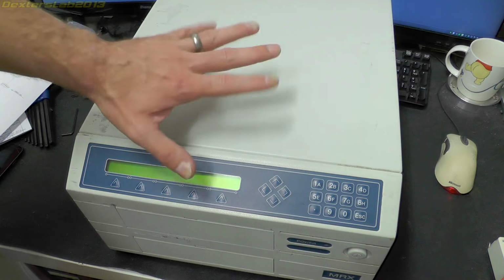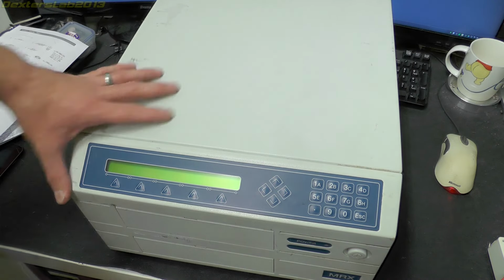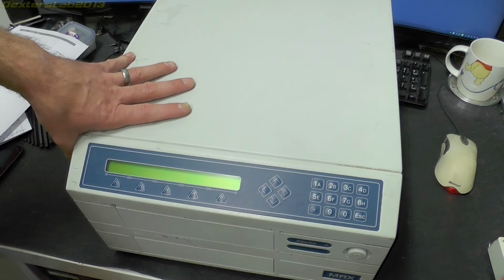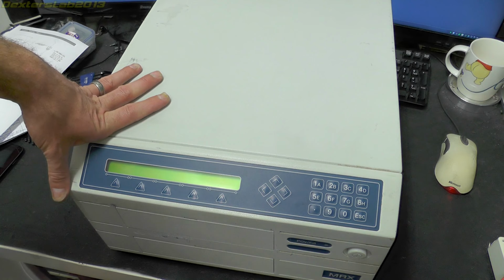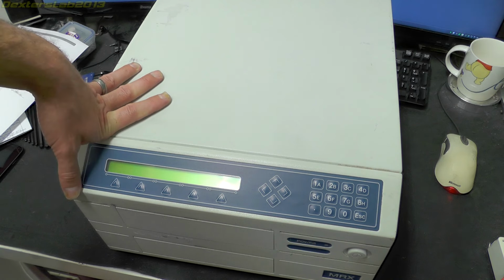Today we've got this interesting beige box that I've just picked up, obviously being end-of-lifed. So let's have a quick look around this and I'll explain what it is. So this is a Dynex MRX. It's known as a microplate reader. It's used in the medical and research scientific industries.